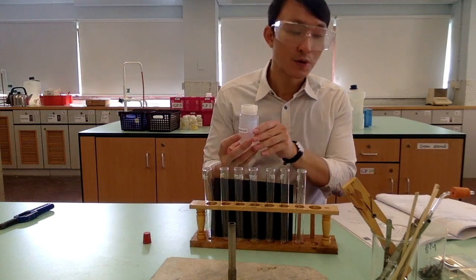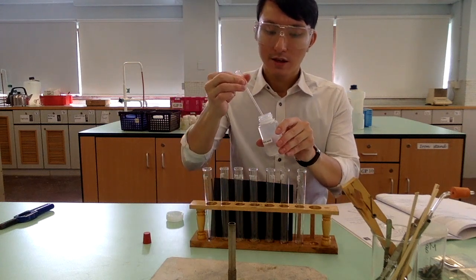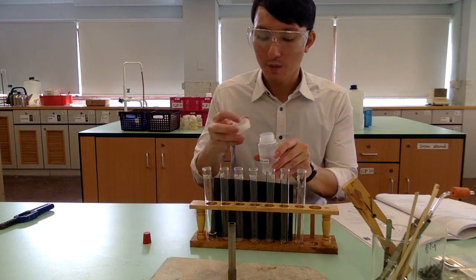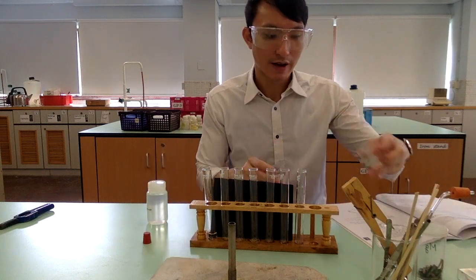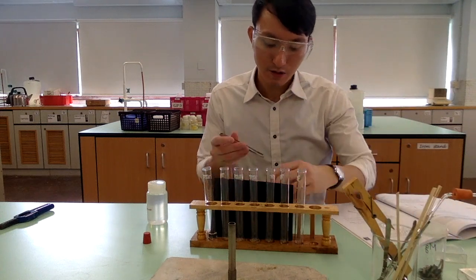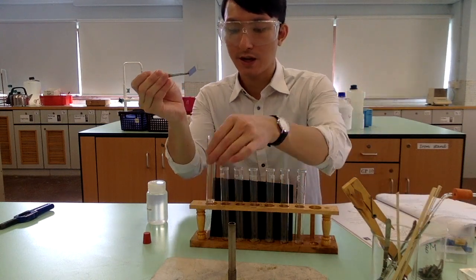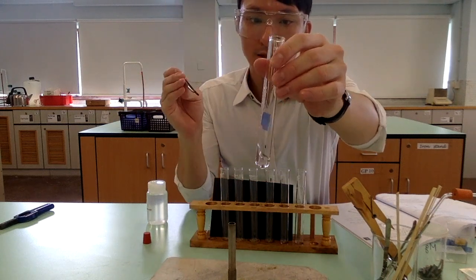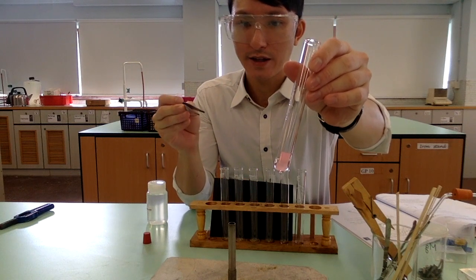add blue litmus paper. To be specific, this is not actually a reaction. This is basically to show you what color you will expect to see if we add blue litmus paper into the hydrochloric acid. But I'm pretty sure you should be able to tell the color change. So right now I have a blue litmus paper, and I have just added the acid to it, and I will simply drop it into the test tube, and you see the blue litmus paper has changed into red.